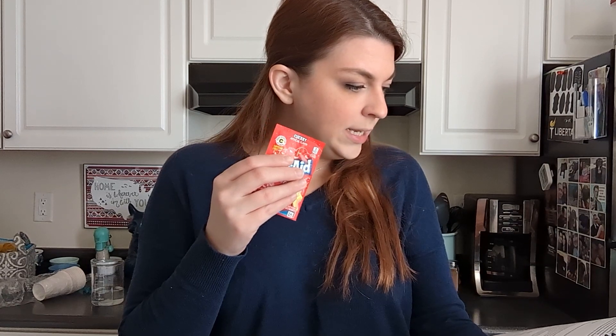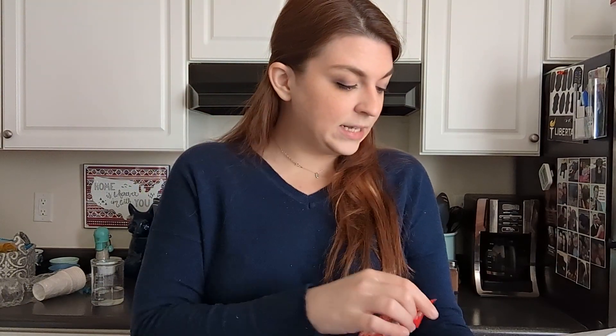You are going to need 250 milliliters of water in three different samples, and you're going to need probably 100 grams of Kool-Aid. We're going to downsize that. Instead of our samples being 250 milliliters, we're just going to do 10 so that we can use just about four grams of Kool-Aid. I think it's just under five. So two packets of Kool-Aid is going to be just fine. It does not matter what color.